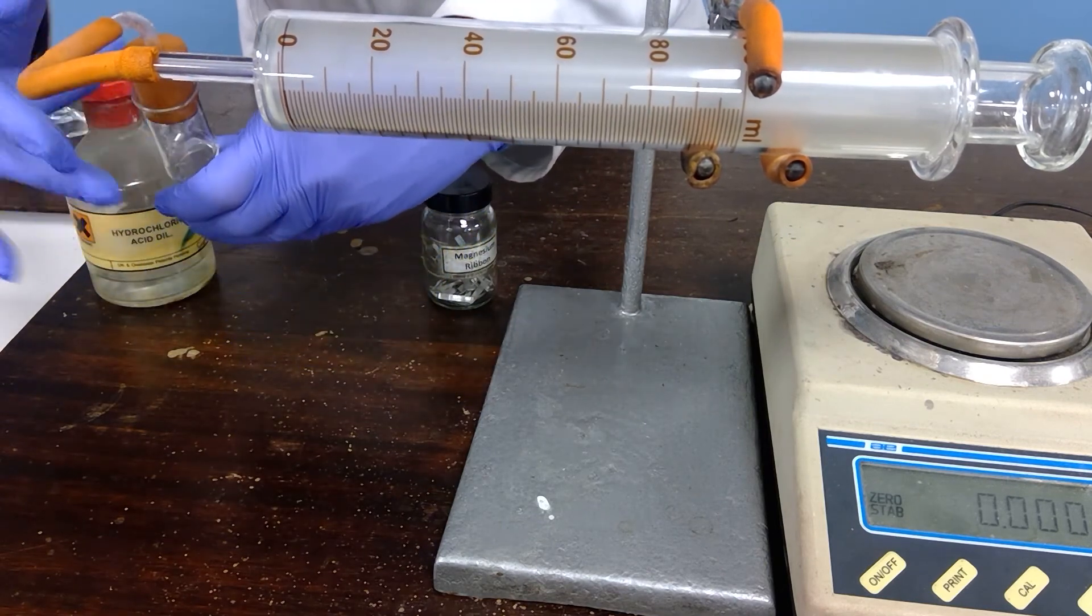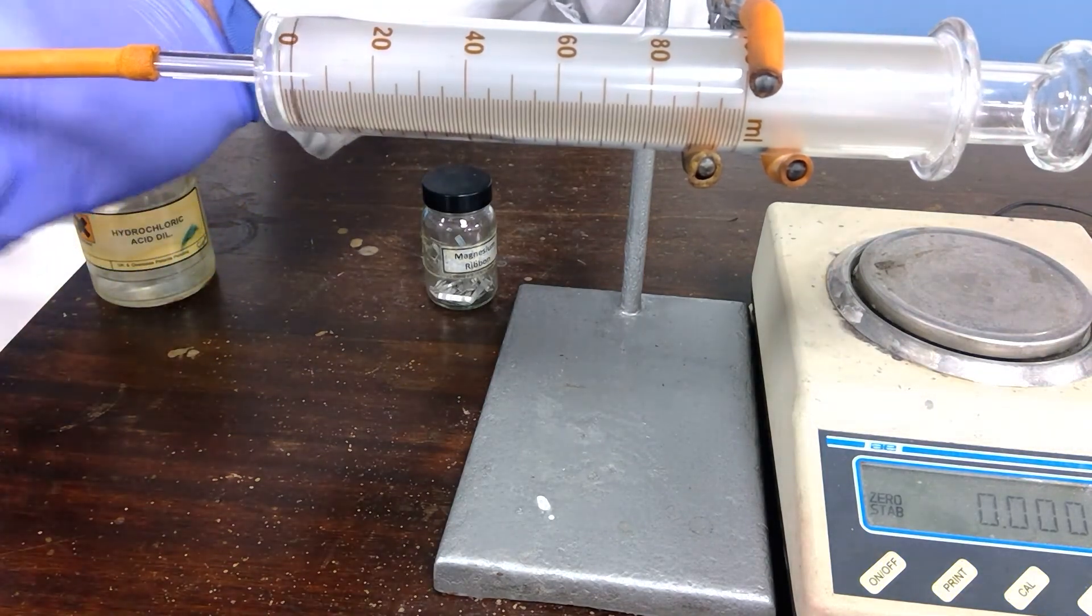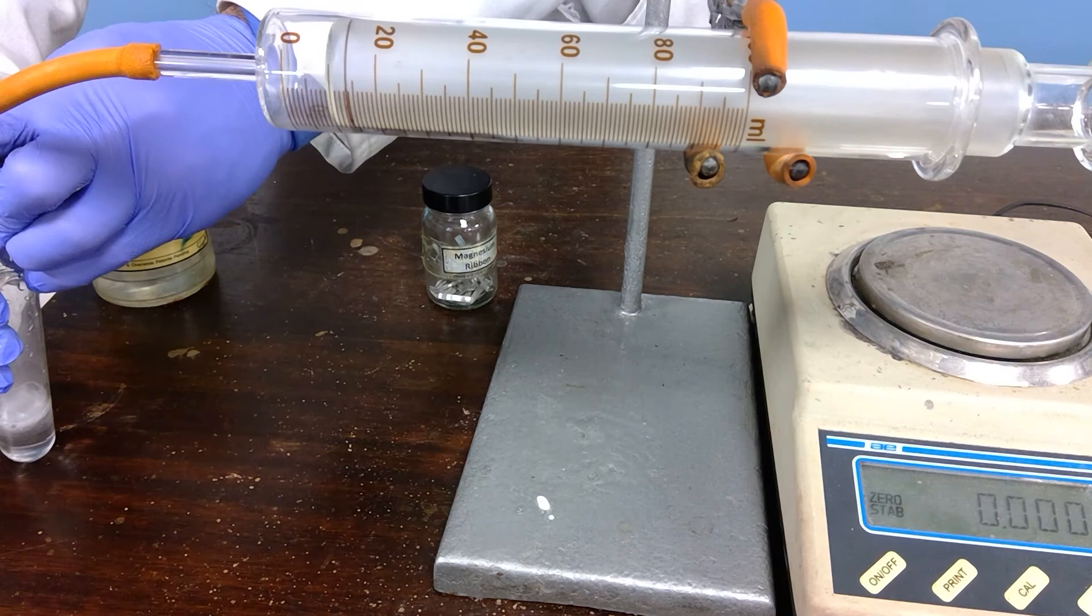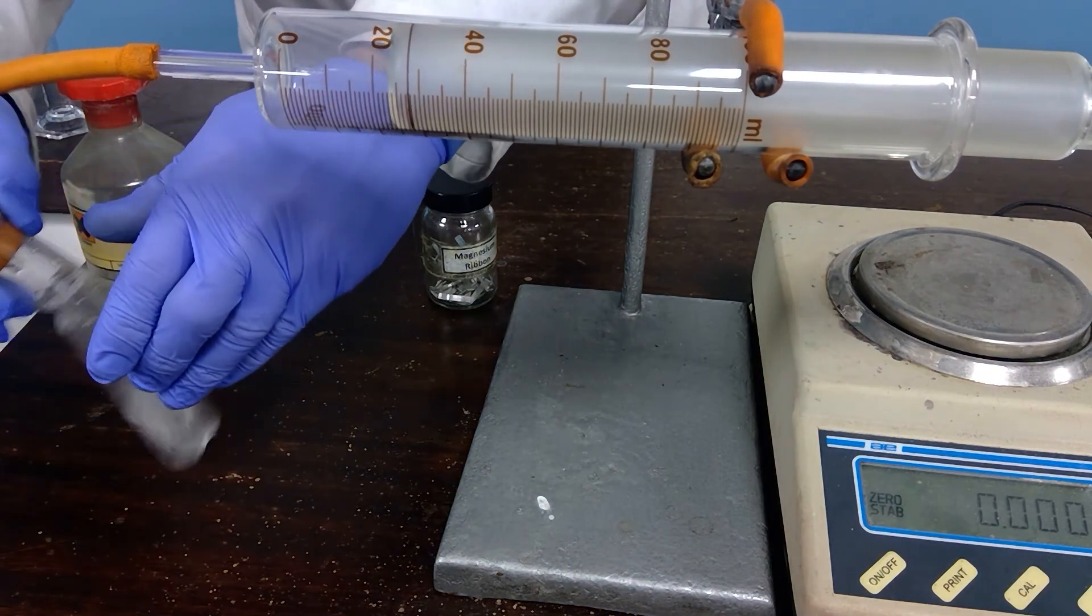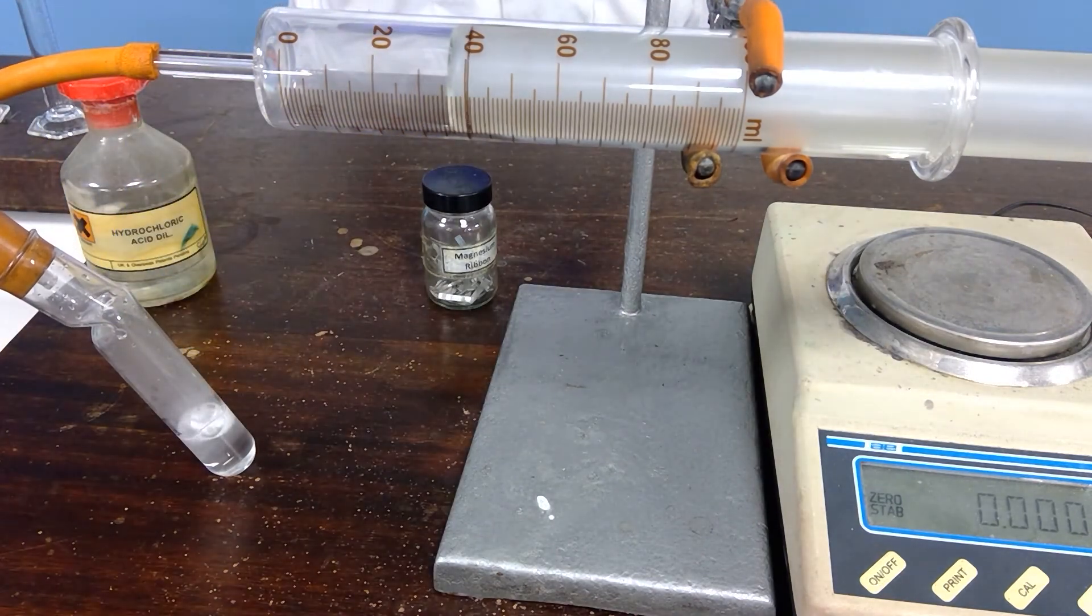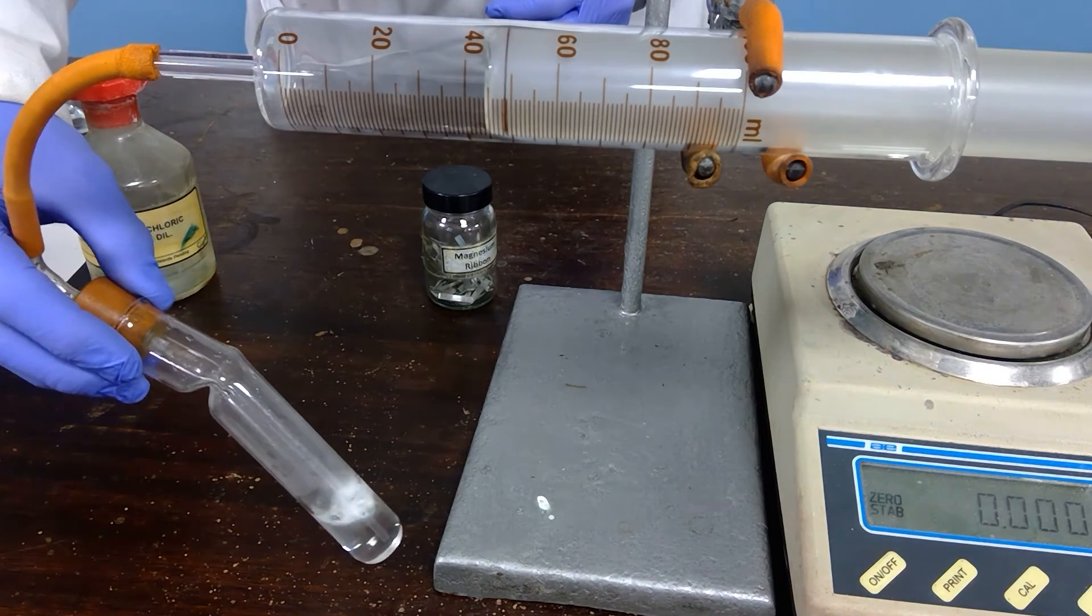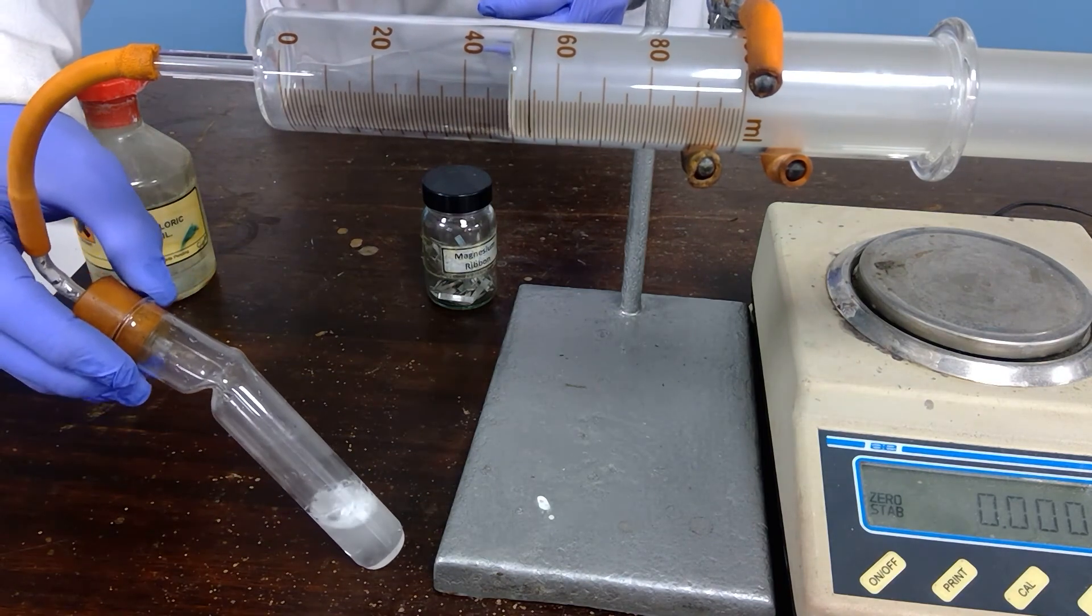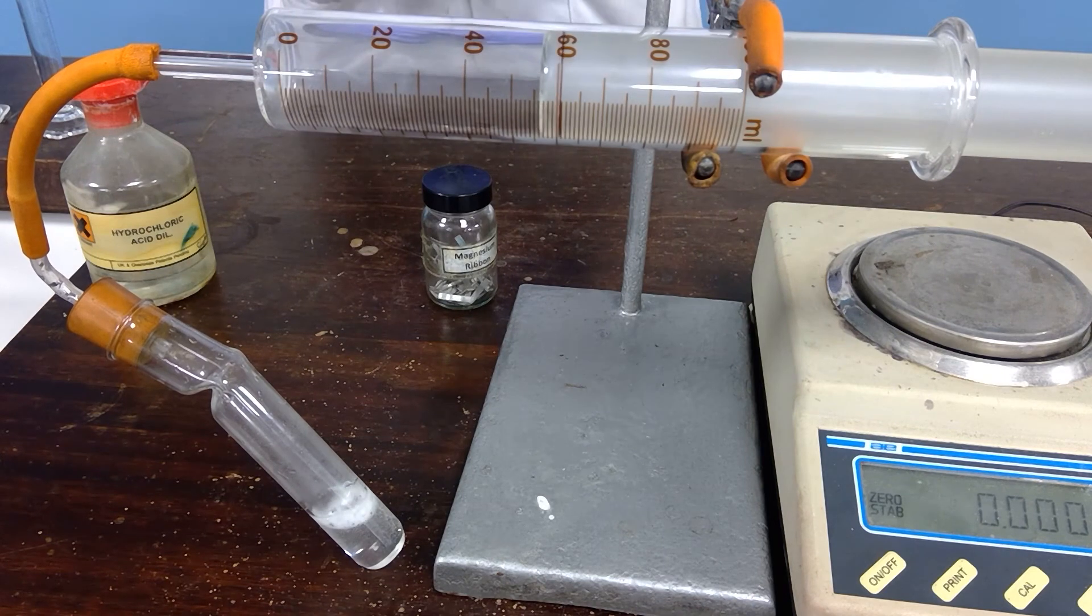We'll encourage that to fall to the bottom. There it goes. We'll allow that reaction to occur. Once again it's a bigger piece of magnesium, so we would anticipate a greater volume, perhaps, of the hydrogen gas, which seems to be the case.